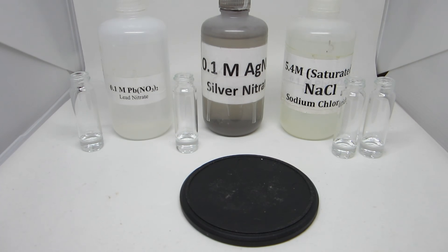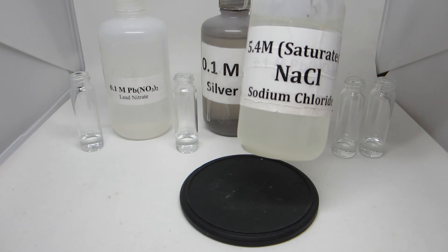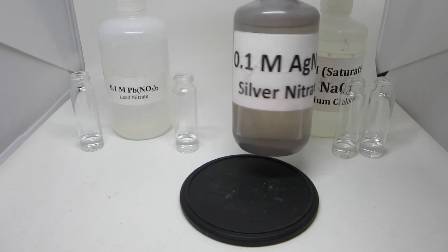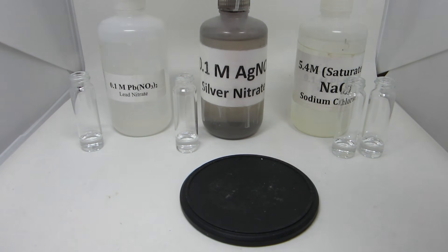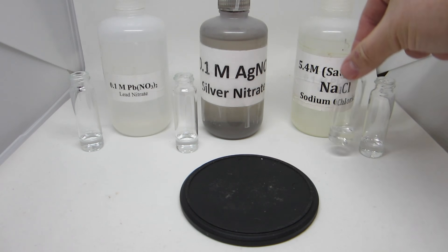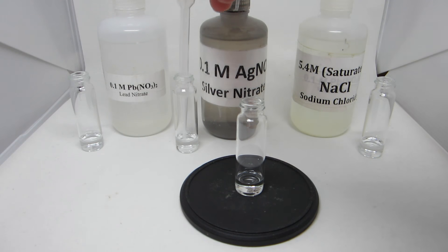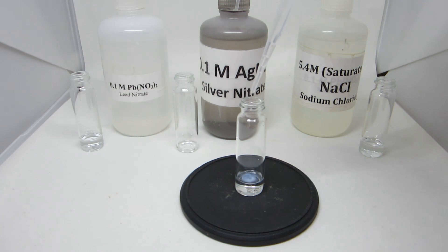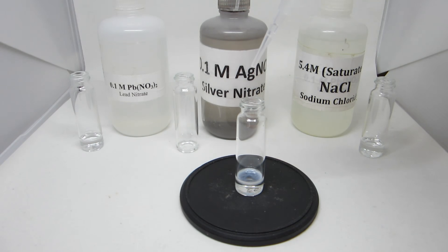Reactions 1A and 1B are reactions between saturated sodium chloride solution, 0.1 molar silver nitrate, and 0.1 molar lead nitrate. All three of these solutions are clear and colorless. When taking a saturated sodium chloride solution and reacting it with silver nitrate, it takes one to two drops before a precipitate forms.